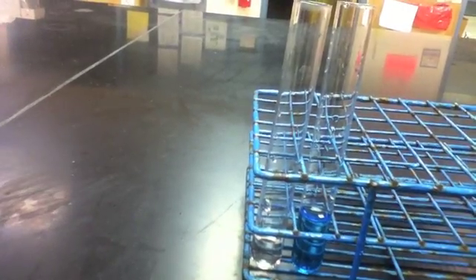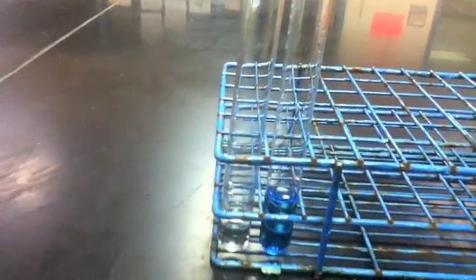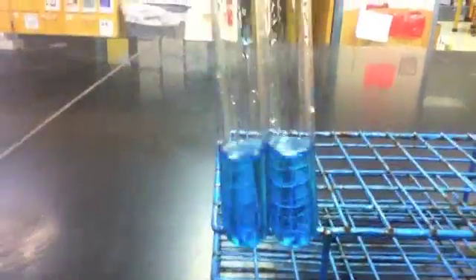I'll then take Benedict's and also add it to the positive control. However, unlike other detection tests we've done, notice that even when I add it to the positive control, I still see the same coloration as I saw in the negative control, even with agitation.